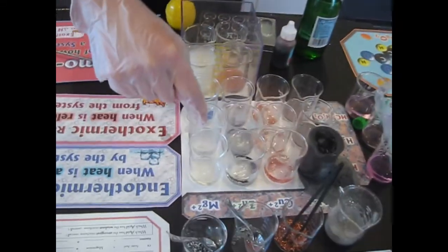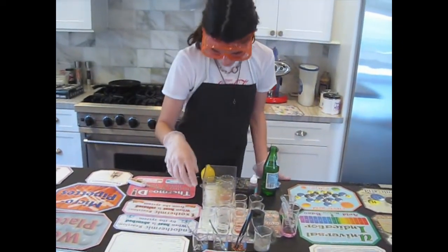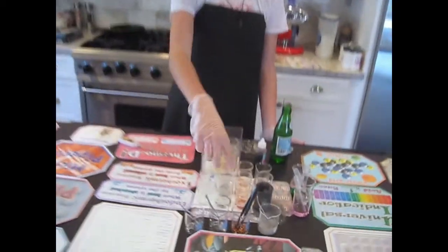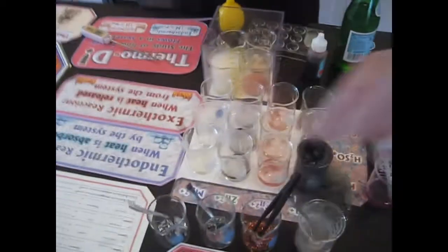Isn't it funny that it took a little while to start? Yeah. So that's why in chemistry we have to be patient. And what other reactions did you see? This one, and now everything disappeared from it. And which one gave off the worst smell, do you think? These two. Those and the magnesium one. The first, oh my god. The hydrochloric ones in the top row also had the biggest reaction.